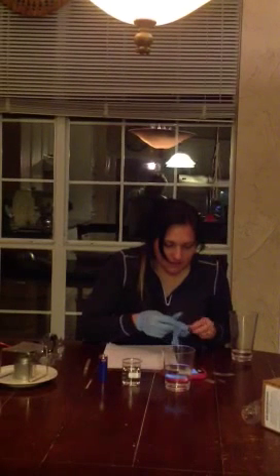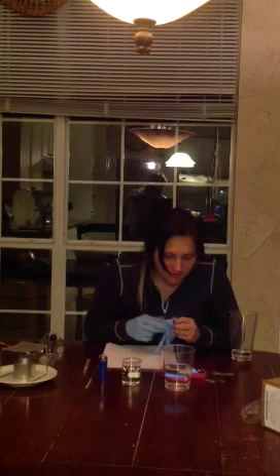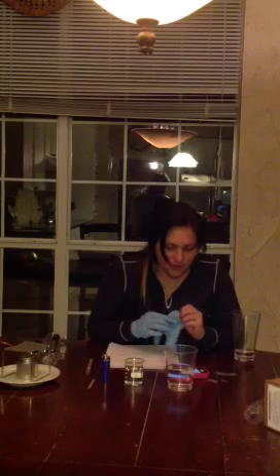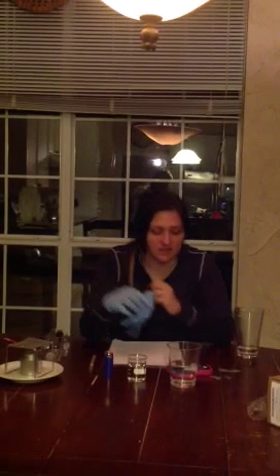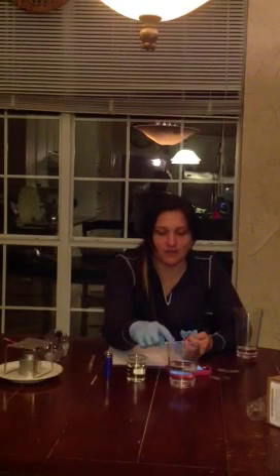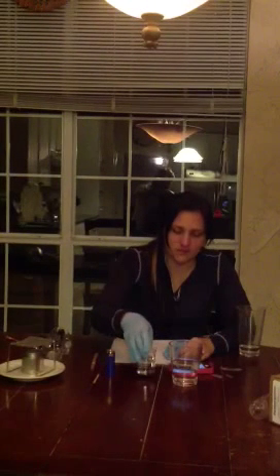The next thing is that we turn on the tap water to hot, which we've already done, and we let the hot tap water run for 5 minutes, or I'm sorry, 15 seconds. And we also transfer the hot tap water from this cup into this 100 milliliter glass beaker, and we transferred approximately 75 milliliters per the request of the lab.